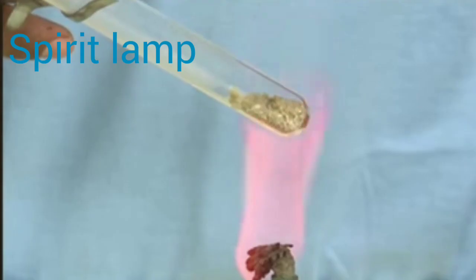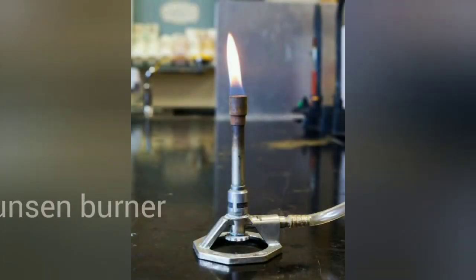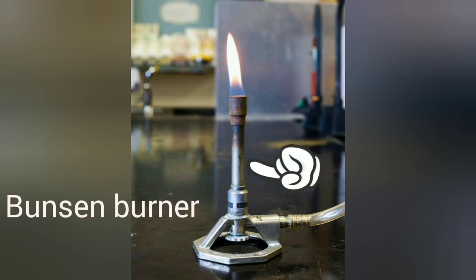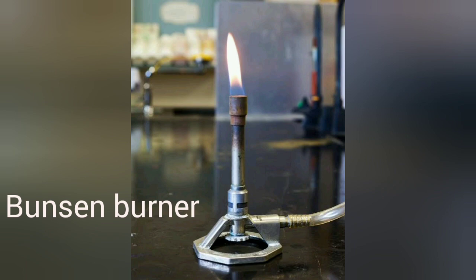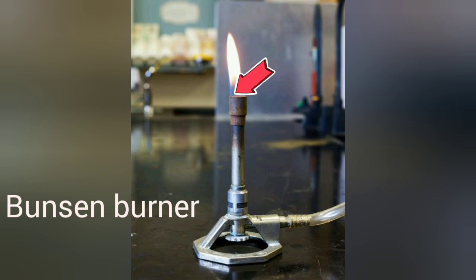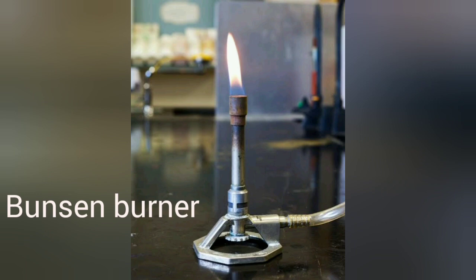The spirit lamp burns or lights up when ignited and is used to heat substances. A Bunsen burner consists of a base made of cast iron with a vertical tube rising from it. When fuel gas is supplied into the Bunsen burner, the gas flows upwards and comes out of the nozzle of the vertical tube, which on igniting with a matchstick burns with a flame. It is used for heating purposes.